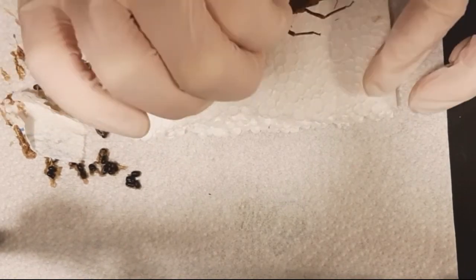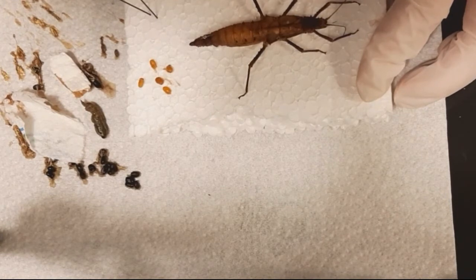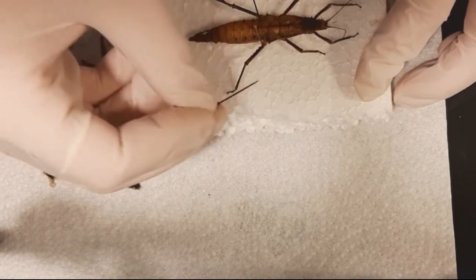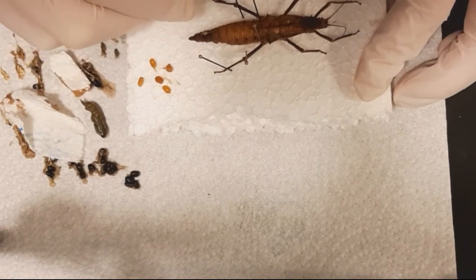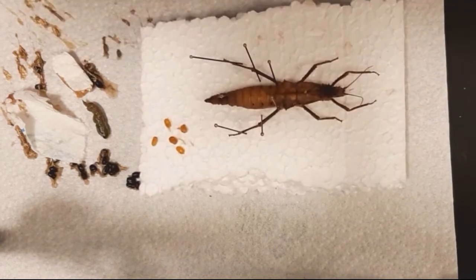If you want to keep coloration perfectly, I would advise freeze drying your specimens. Most people don't have access to a freeze dryer, but you can also freeze dry specimens by keeping them in a freezer for six months up to a year, depending on your freezer's dryness. All the ice inside the specimen will sublimate into gas and preserve the coloration very well, though freezing can make the specimen brittle and may slightly alter the three-dimensional structure. In a freeze dryer this is not a problem, and then you mount it like a specimen already dried and chemically preserved.